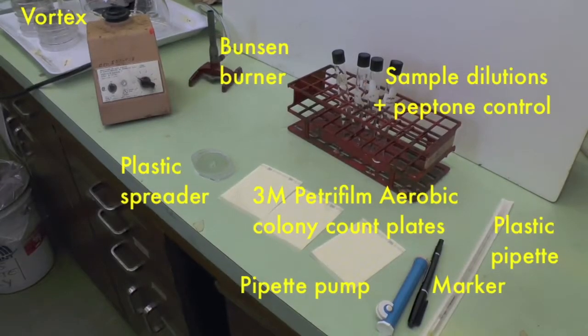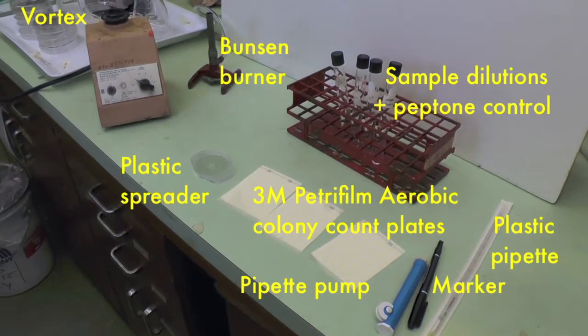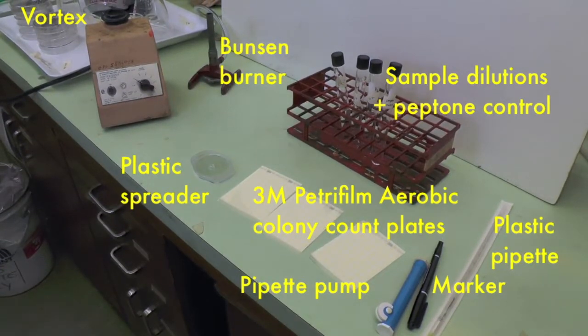In this video, we will demonstrate how to perform the petri film method of enumeration. Here is the equipment you will need.